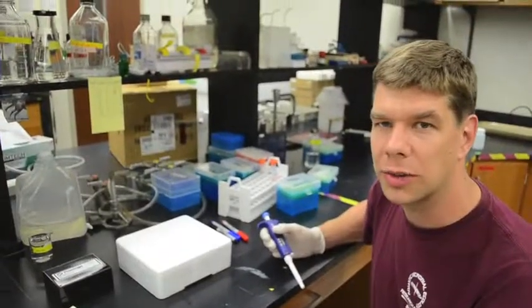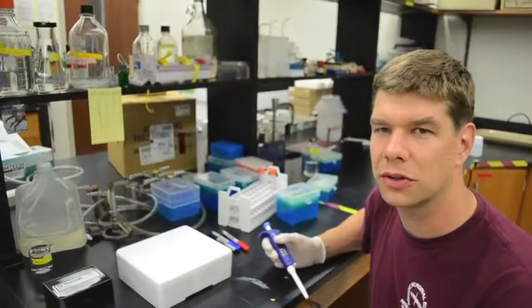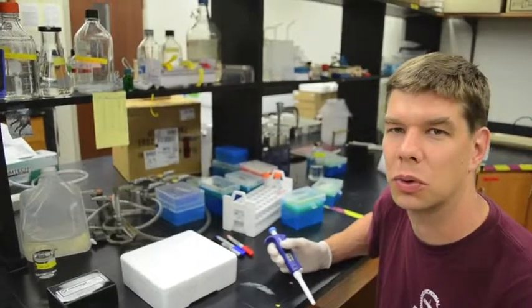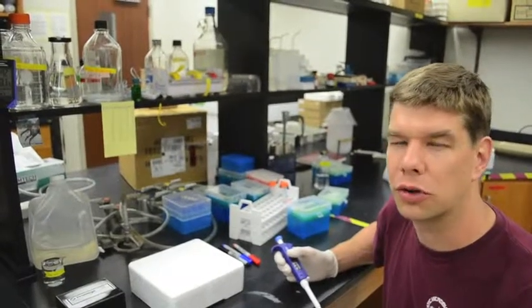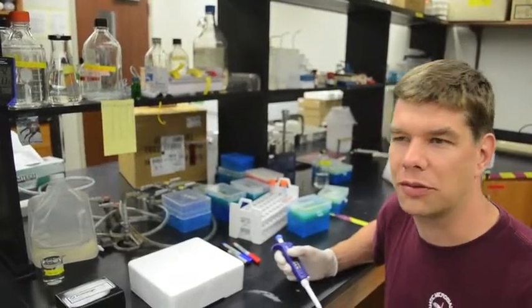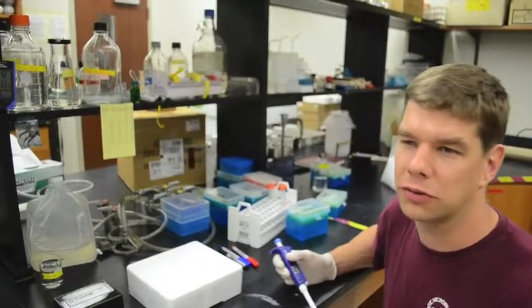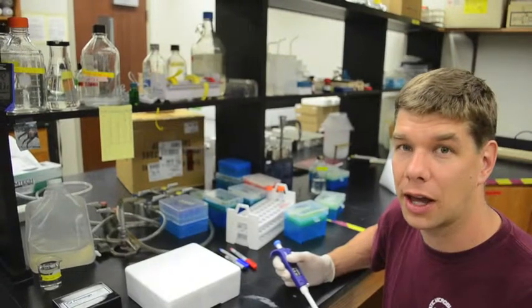So we've got our enzyme incubation started right now. Usually it takes something on the order of a half an hour or maybe a couple of hours to get good measurements of enzyme activity. We'll want to take maybe 4 to 6 measurements of the fluorescence over the course of, like I said, maybe a half an hour to 2 hours in order to get good measurements of the rate of fluorescence production. So while we're waiting for that to happen, we should calibrate our standards.